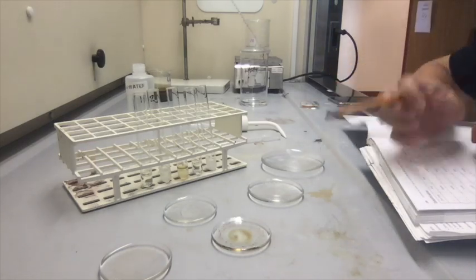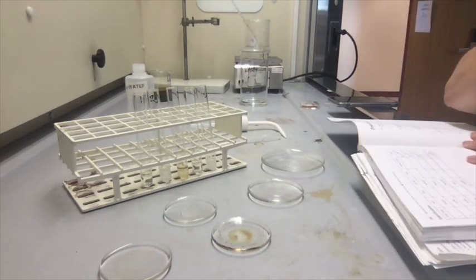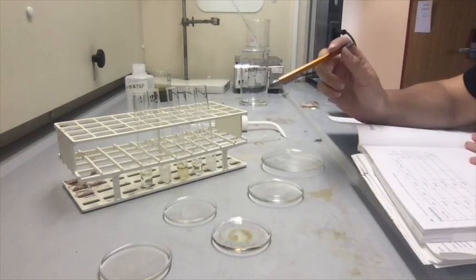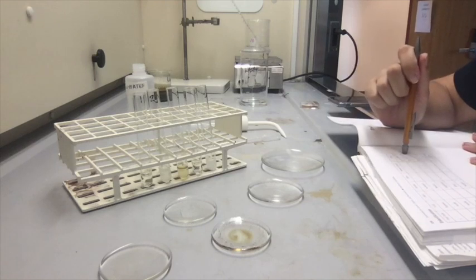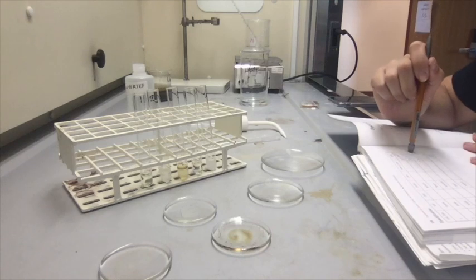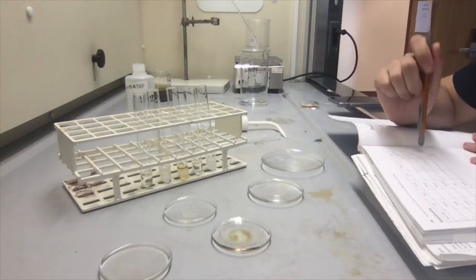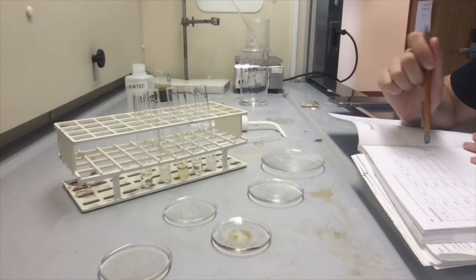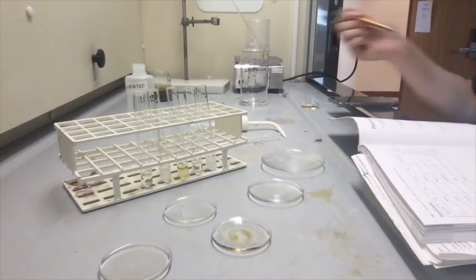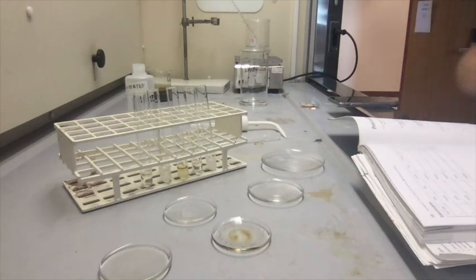So I asked my coworker to smell them, and I think we finally figured out what each of them smell like. So test tube number 1 smells like raspberries. Test tube number 2, we said that it smelled like peaches. Test tube number 3 smells like banana. Test tube number 4 smells like nail polish remover. And test tube number 5 smells like wintergreen. And that should give you everything you need to finish your lab report, results section, post-lab, pre-lab, and everything.